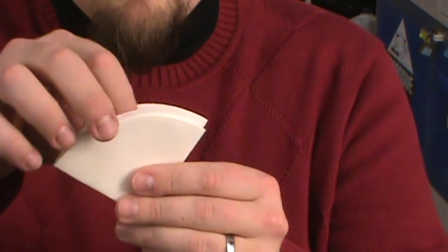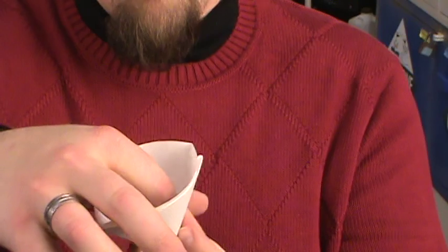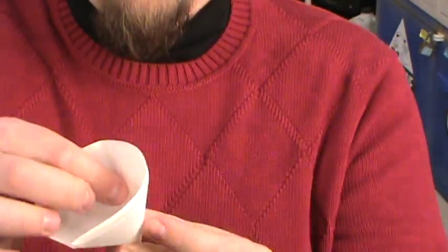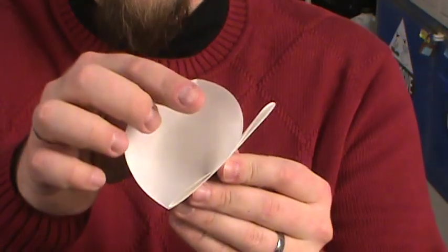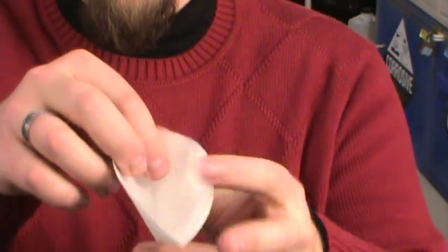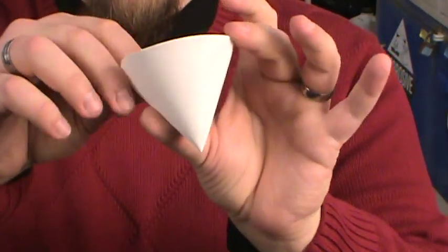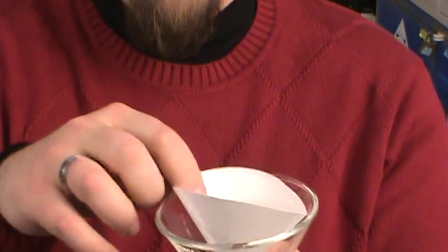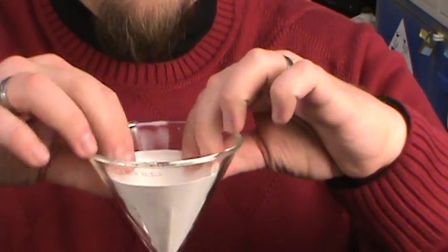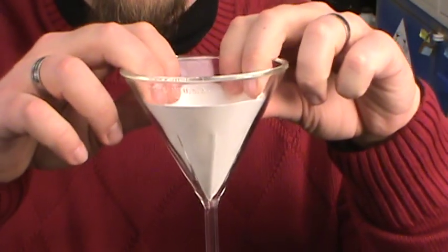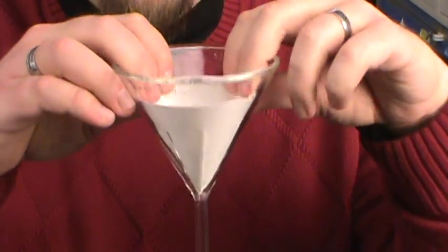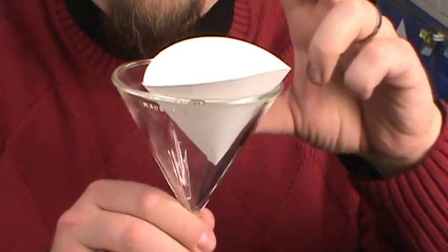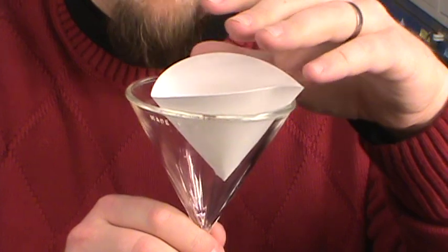To fit this into a glass funnel, open up the larger side, so now we've got three layers of paper on one side and one layer of paper on the other. And what we've made is actually pretty close to a 60 degree cone. When we put this in a glass funnel it sits right down in the funnel. Now if I let go of this it pops up a little bit, but as soon as we get this wet it's going to stick down in the funnel a little bit better.